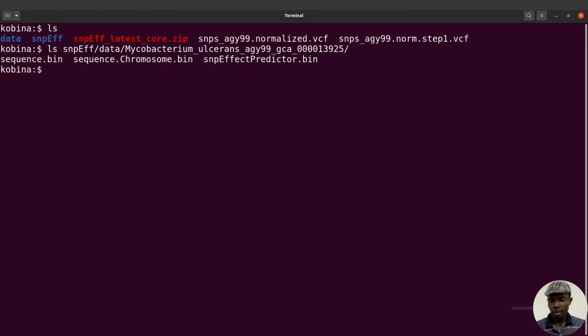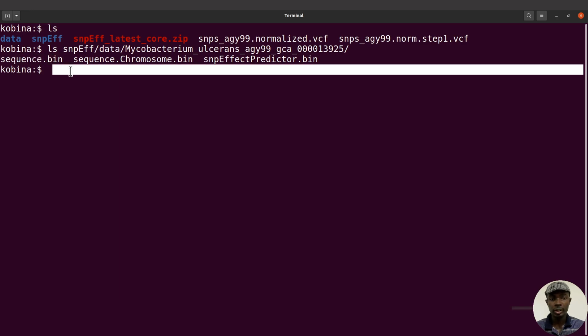All right, so what we are going to do is to examine these files, this and then this, to look at the name that was given to the chromosome. Now what you should notice is that with M. ulcerans agy99, this strain has a plasmid and it also has a chromosome. So we need to look at all those. I will start with this one here. There's sequence.bin.